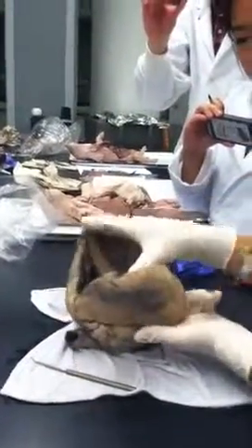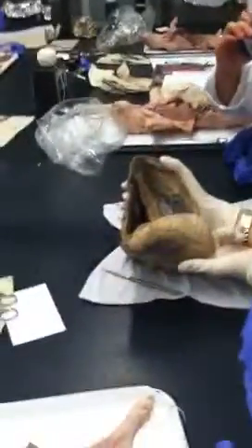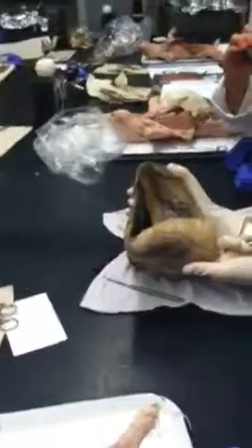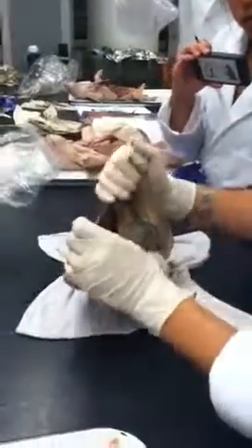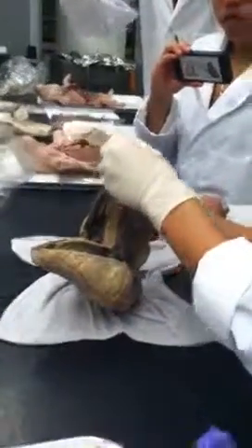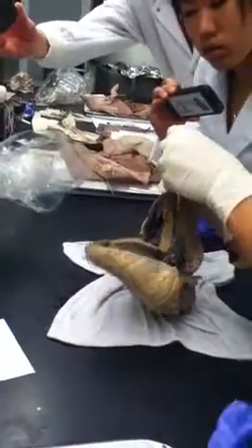Okay, everyone can see? Not really. There we go. Left atrium, right there. So then left atrium, then there would be the bicuspid valve, and then this is the left ventricle. So something to note, and then actually, here, I'll point to this. This right there, the thing below my pointer, that's the semilunar valve.